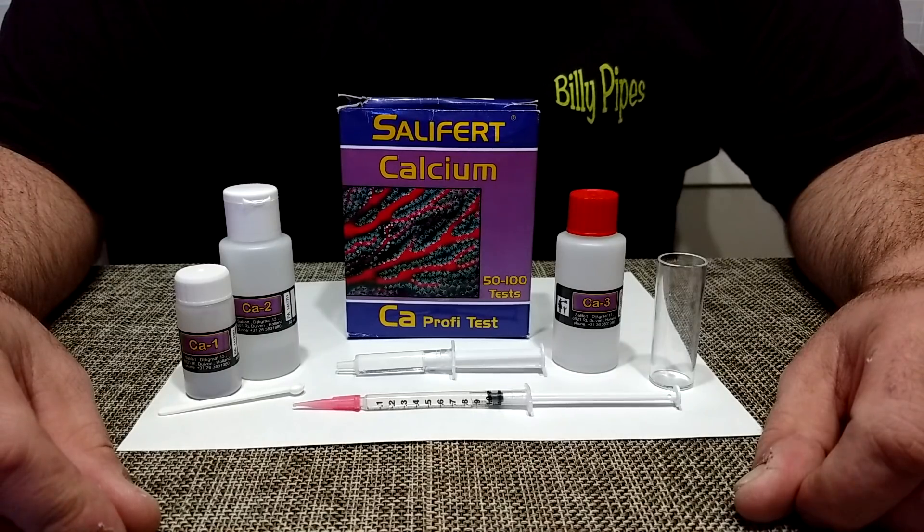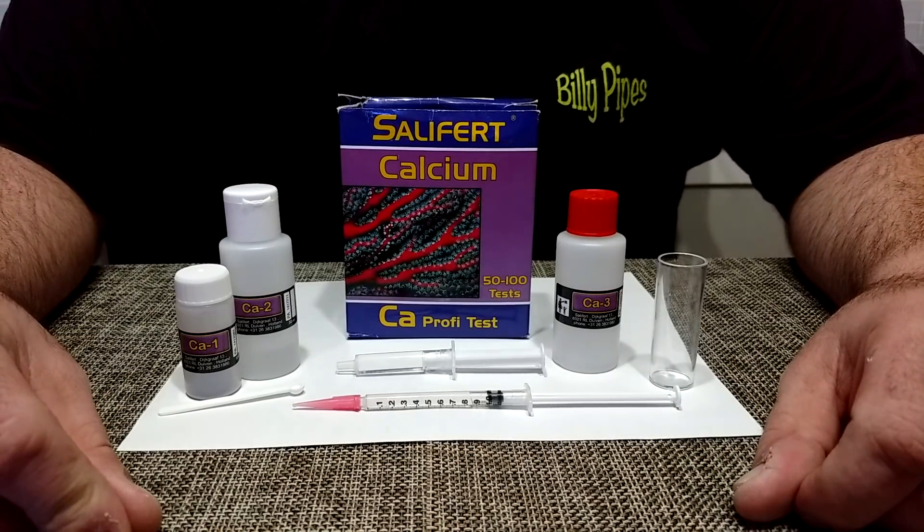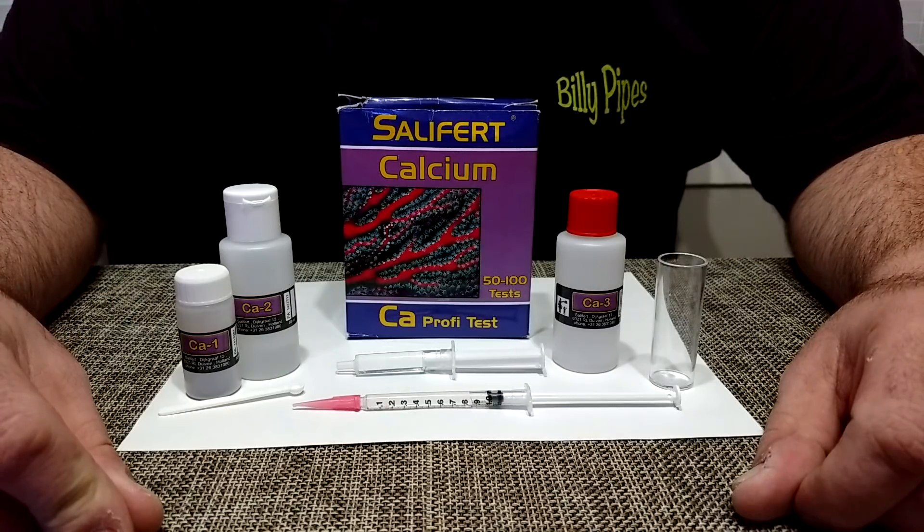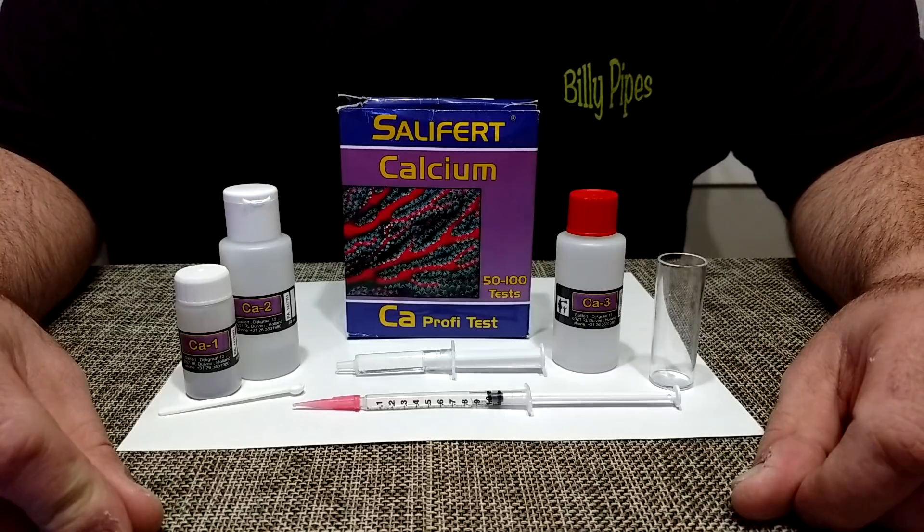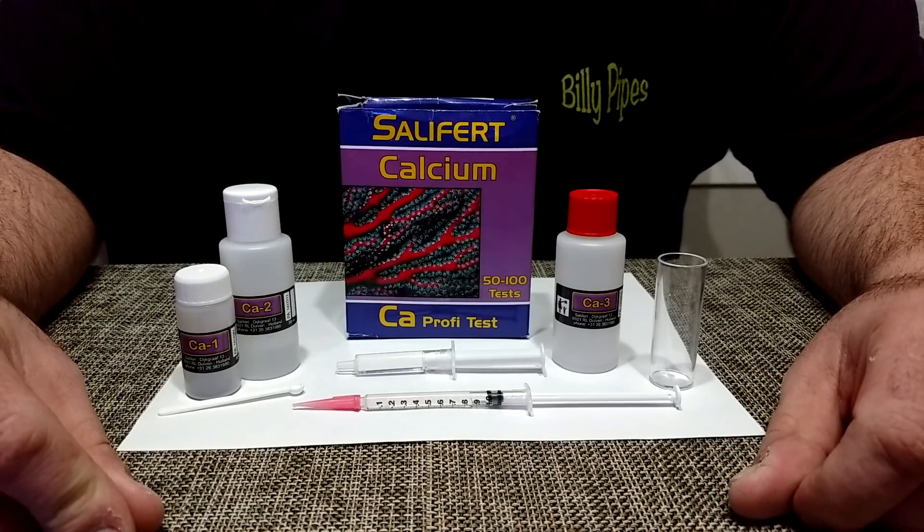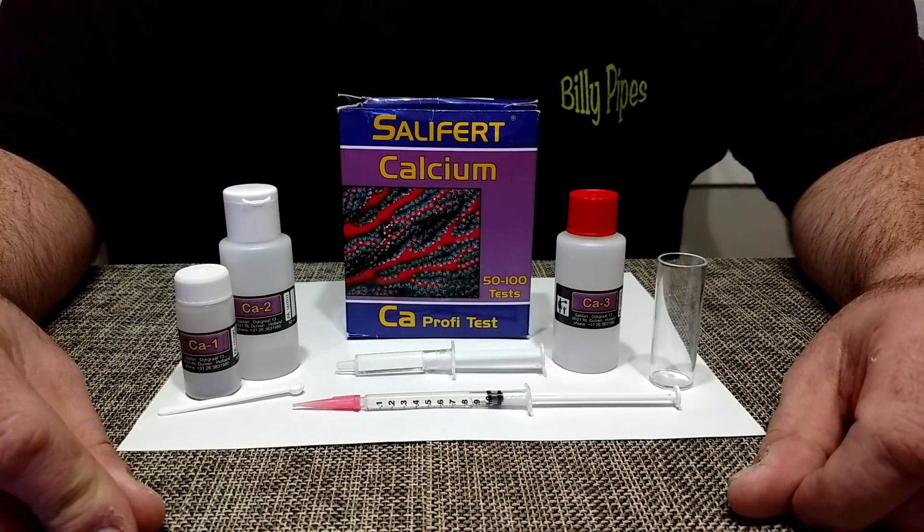So today we're going to be going over the Salifert test kit to test your calcium. It is another simple test kit that I like using and I consider to be very accurate and very affordable.